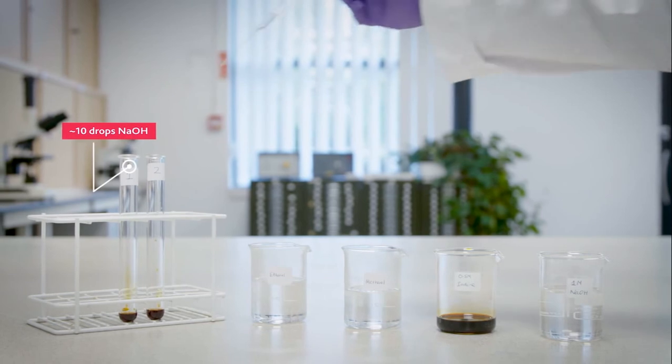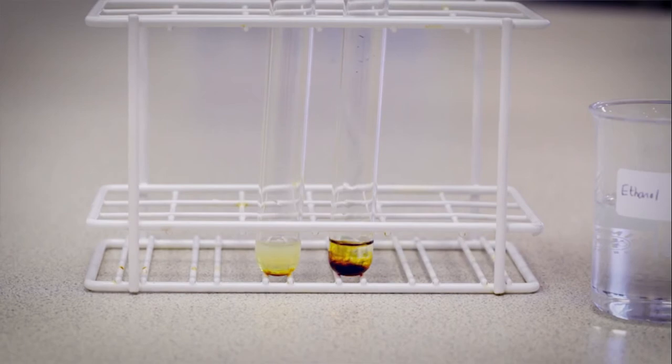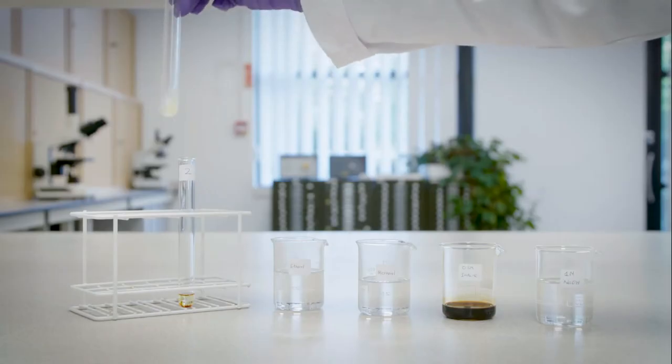And finally, sodium hydroxide solution is added to each tube. The mixtures are shaken gently.